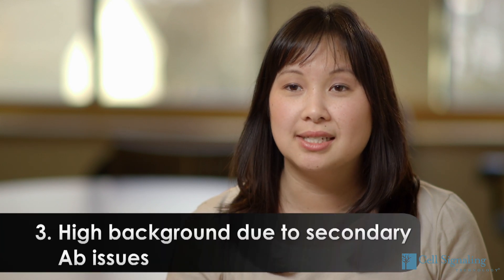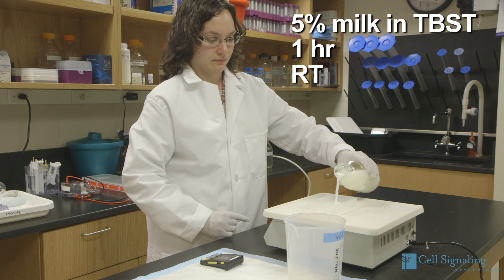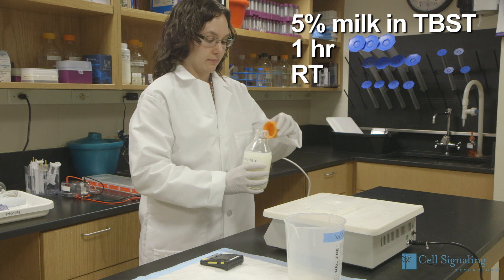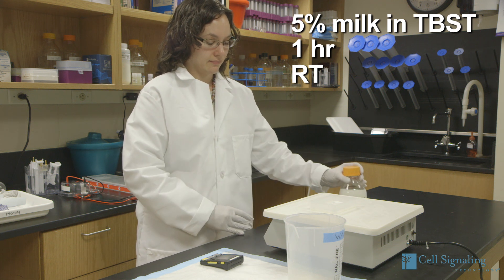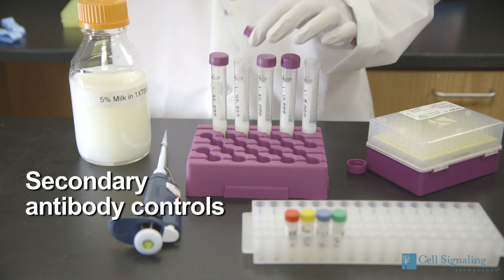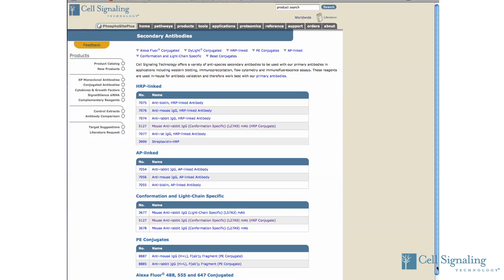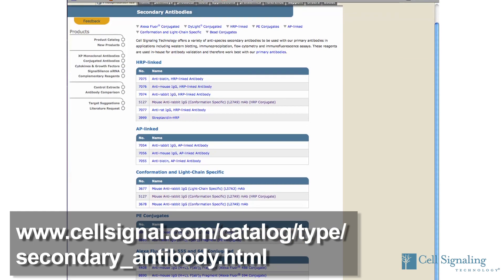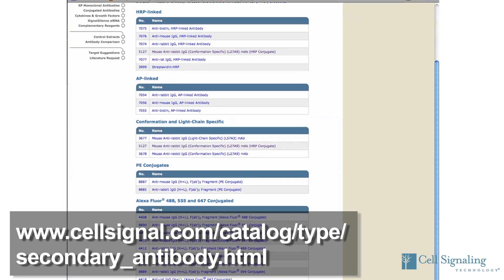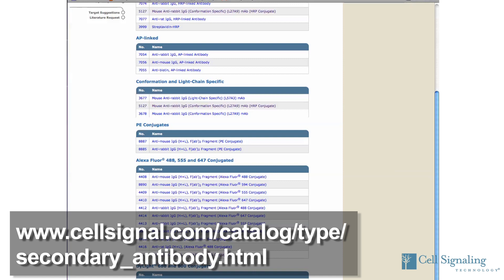Proper dilution and incubation of the secondary antibody is important to minimize high background, as some secondary antibodies bind nonspecifically to proteins and cell extracts. Always incubate the secondary antibody in 5% milk in TBST for one hour at room temperature — diluting the secondary antibody in BSA results in high background. Serial dilutions can be performed to optimize secondary antibody concentration. CST offers secondary antibodies with predetermined optimal dilutions, which are used in-house for antibody validation and optimized to work with CST primary antibodies.